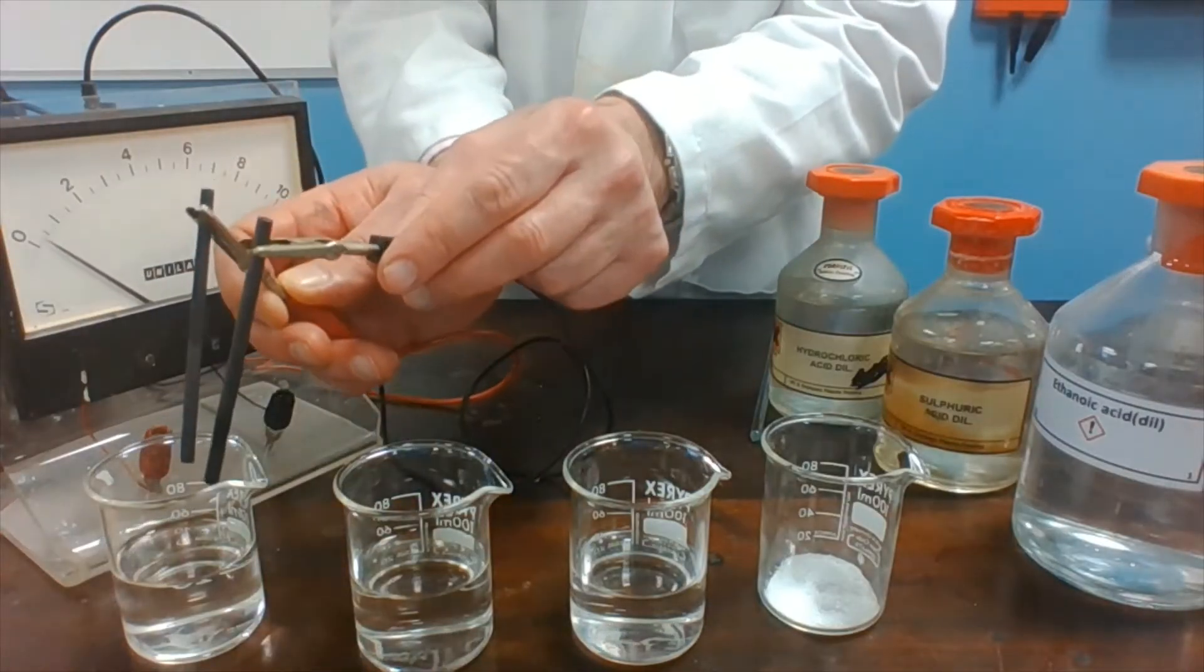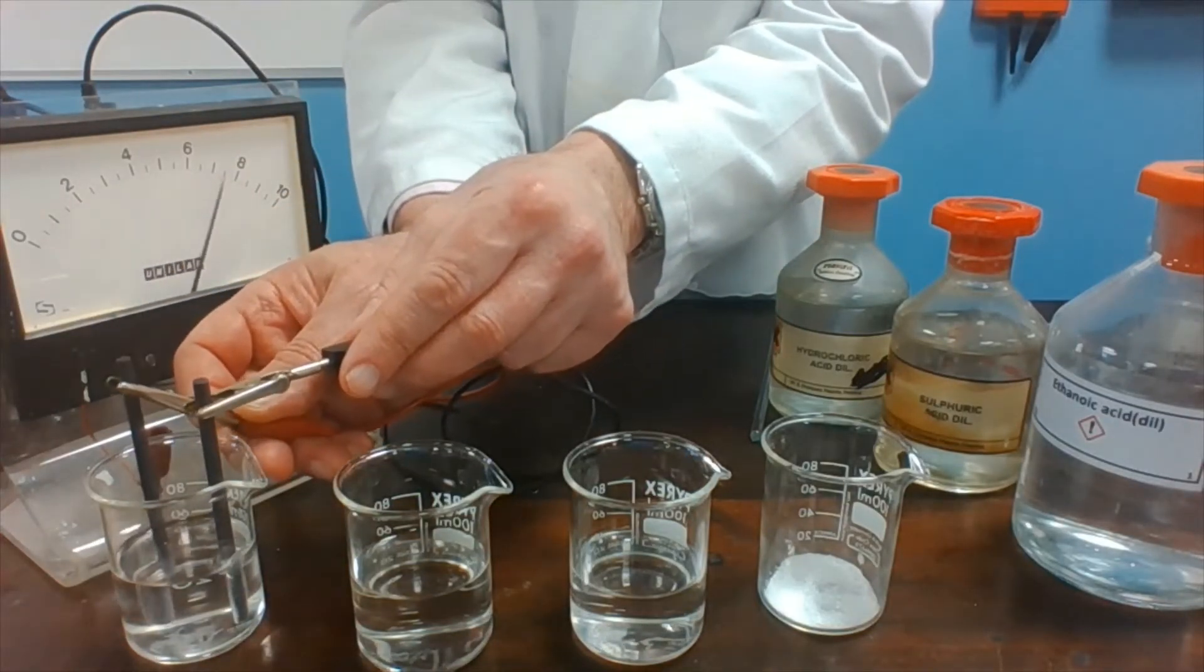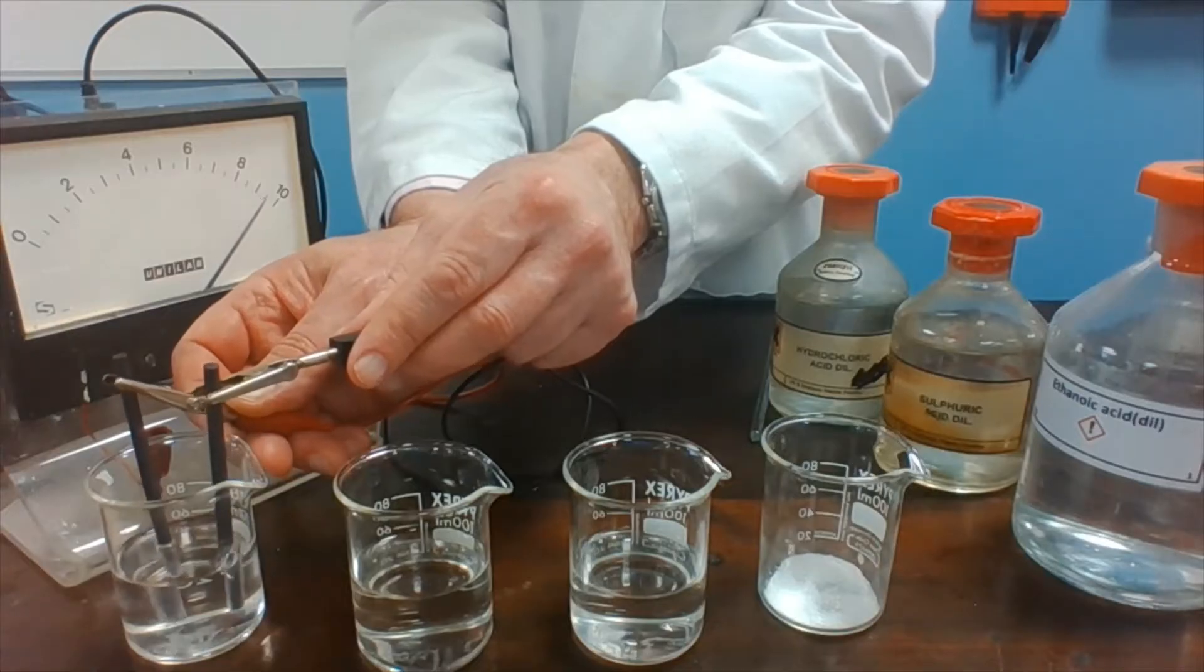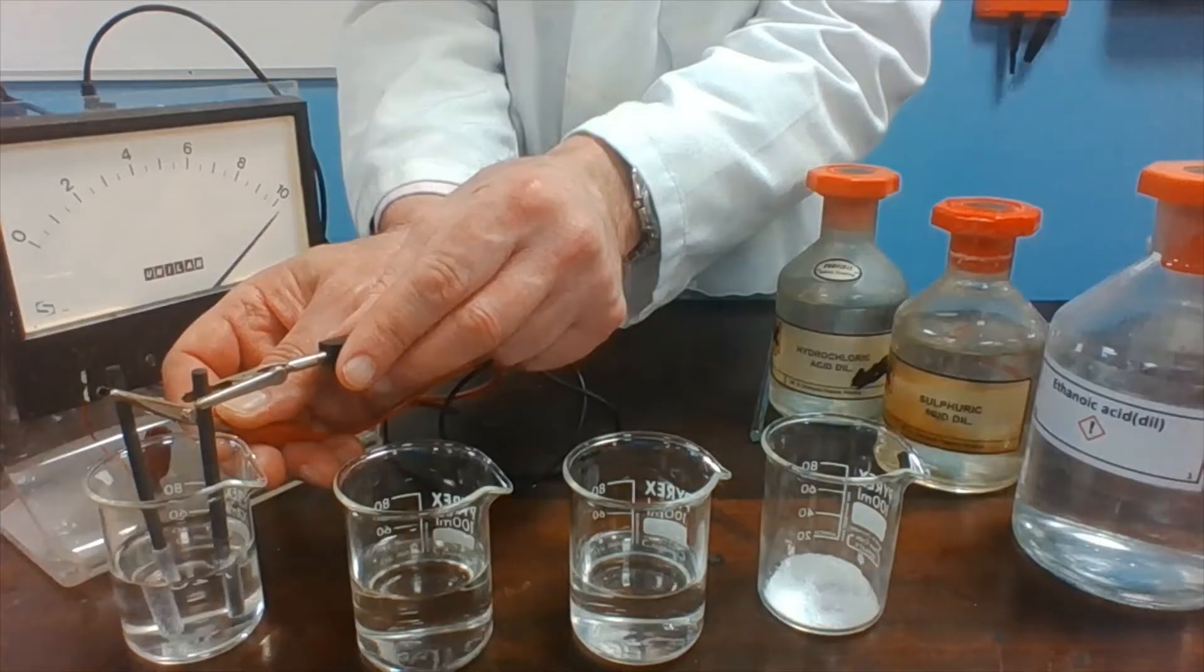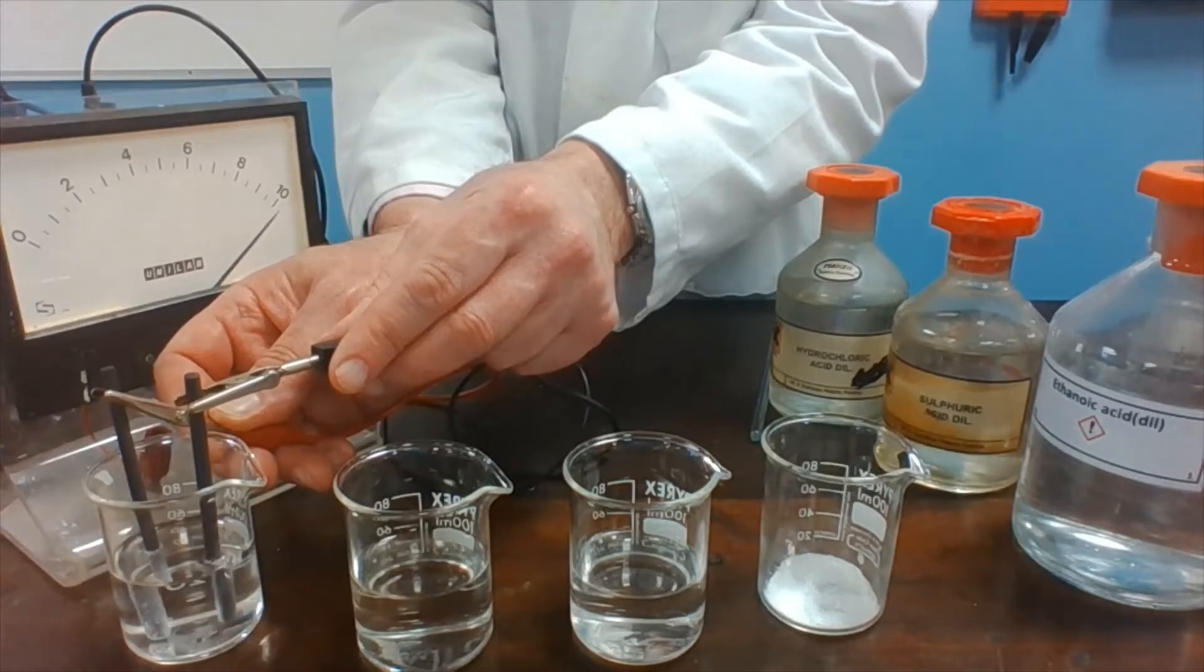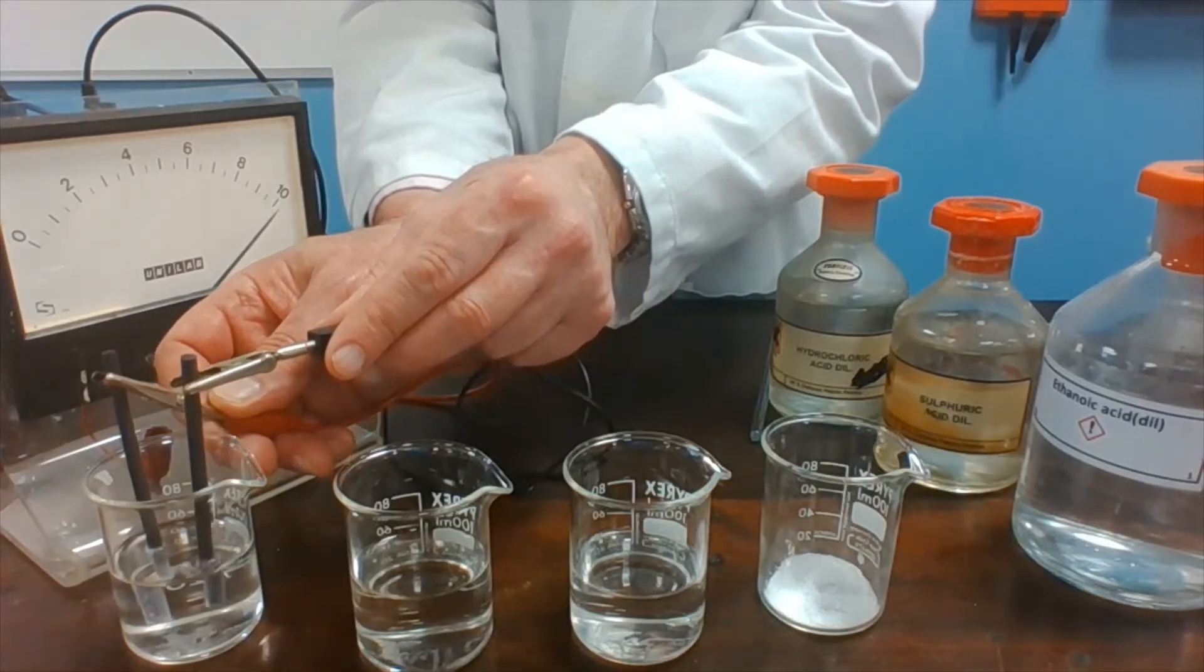If I put the two electrodes into the hydrochloric acid, you'll notice that it registers a current. And if you look at the solution in the beaker, bubbles of gas are coming off at both electrodes.